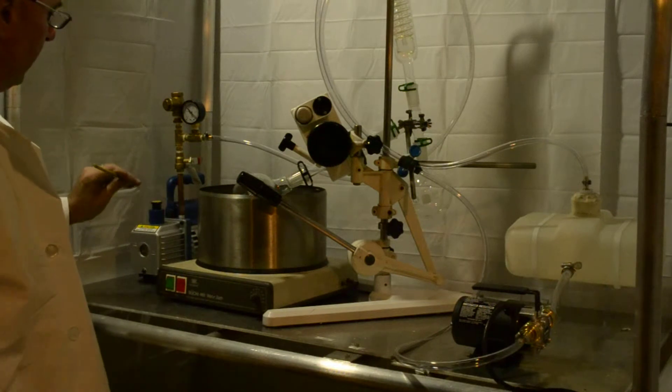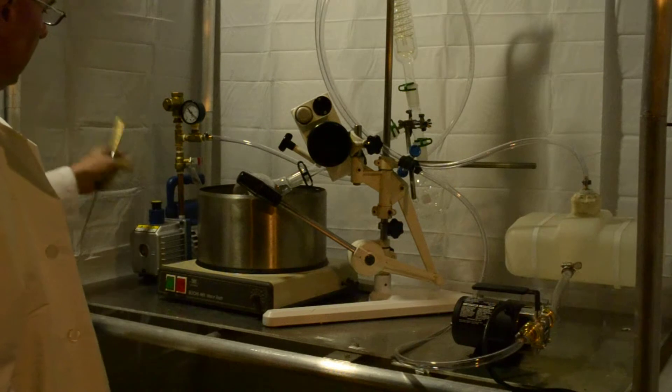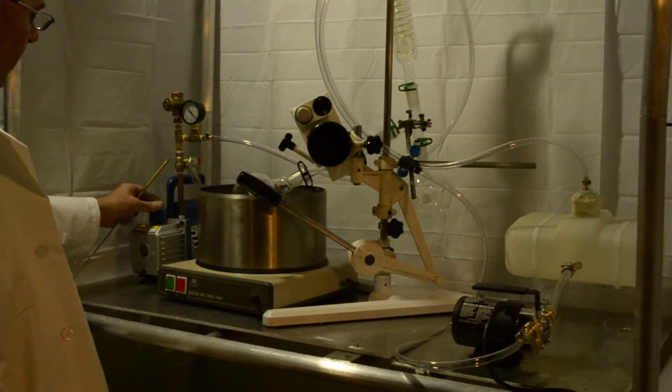There's your gauge. All you have to do is screw this in, all your Teflon plumbing tape's on. Make sure to remove your cap to breathe when you're running your pump.